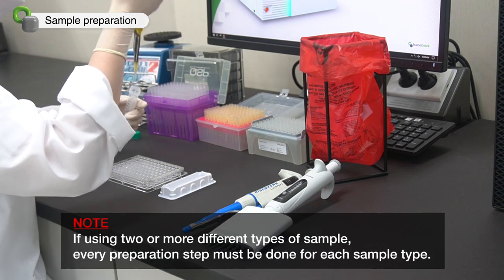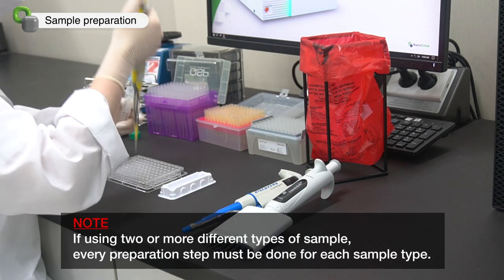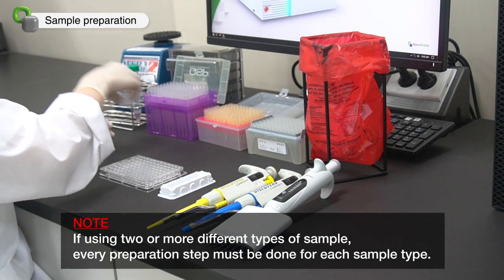If using two or more different types of sample, every preparation step must be done for each sample type.